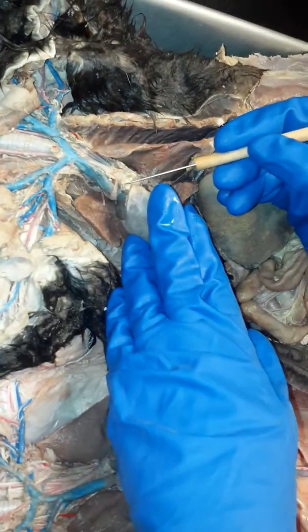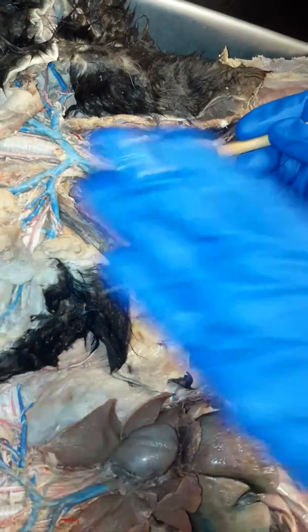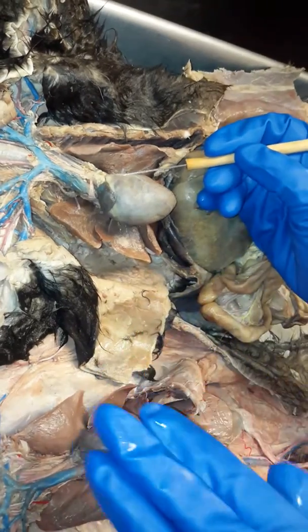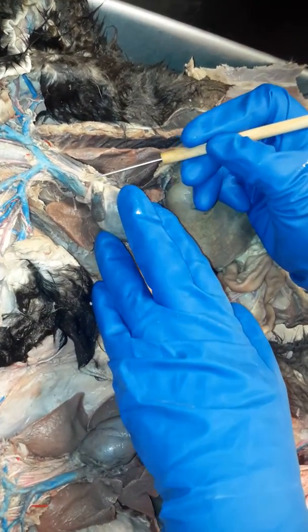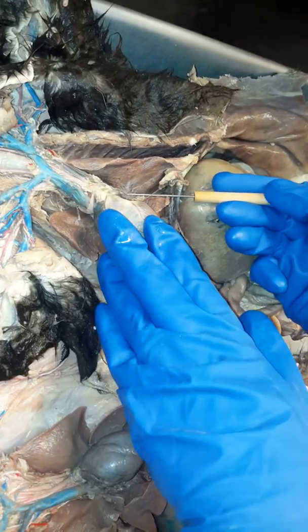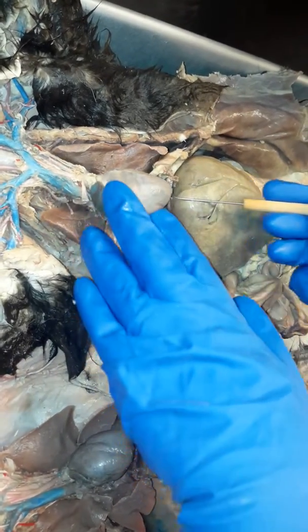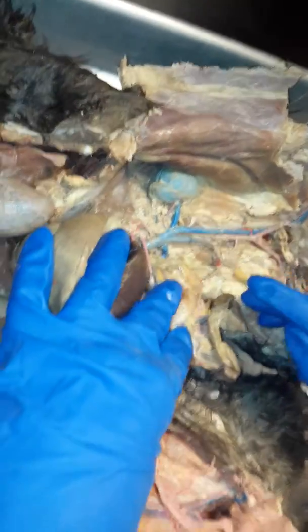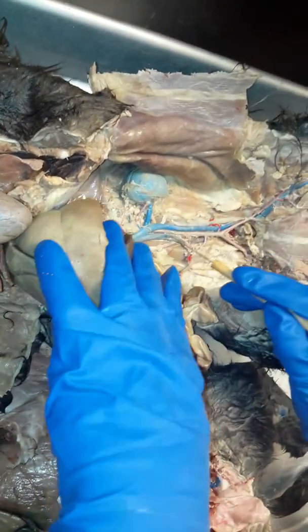So remember the aortic arch on the top? All right, so we have the branches like the brachiocephalic and the left subclavian that comes off to the top and is in the thoracic cavity. But the aortic arch will wrap around. The part that's behind the heart would be the thoracic aorta. And once it gets down into the abdominal cavity, it's going to be the abdominal aorta.